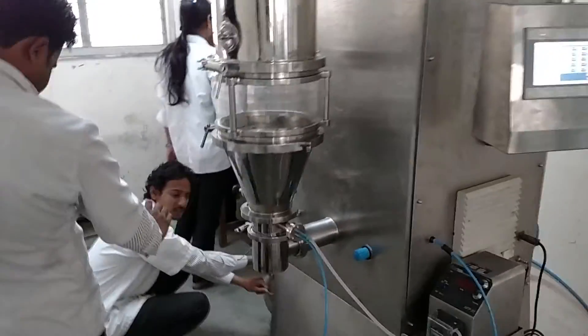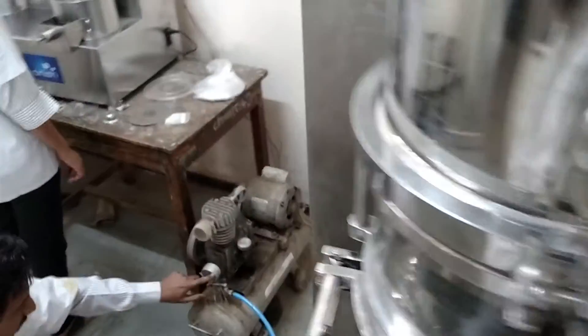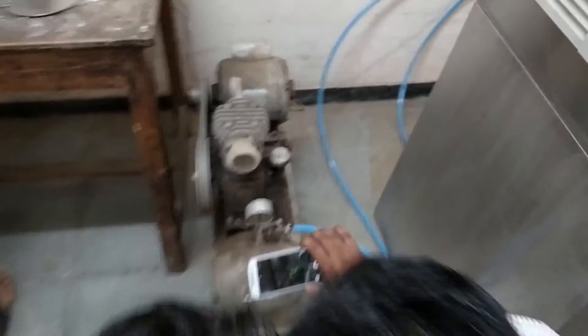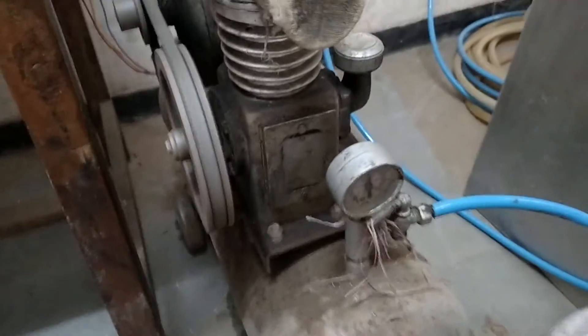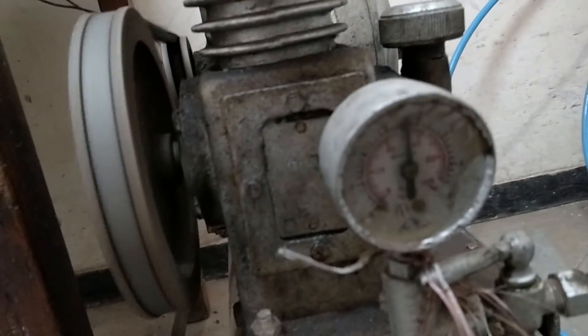From here we have started the compressor machine. This is the compressor machine. We can see that the compressor air pressure is rising. The air is being compressed and we have now started to build up the pressure.